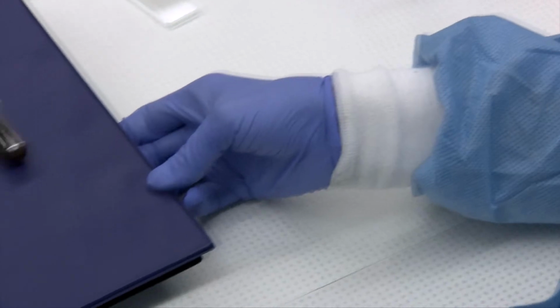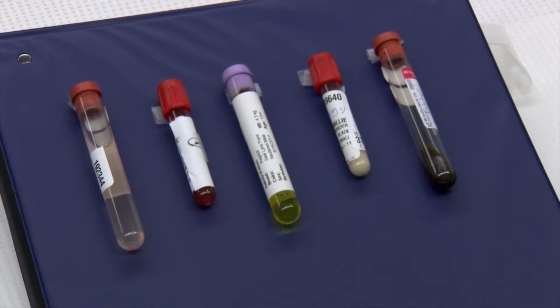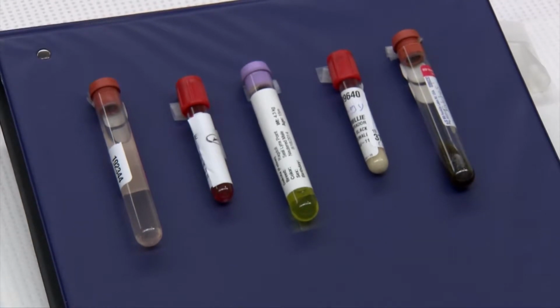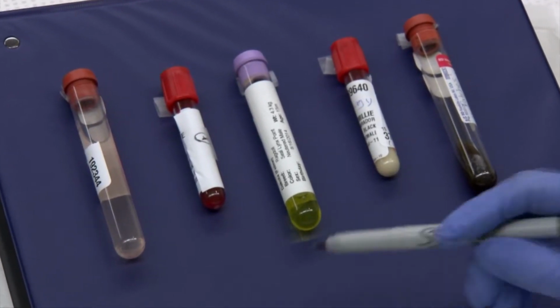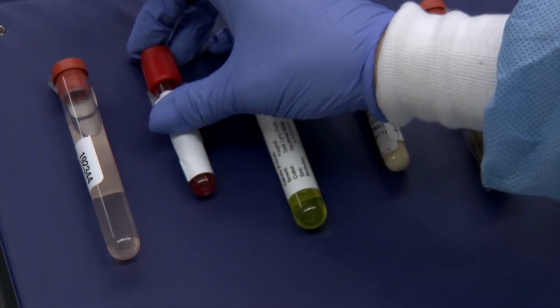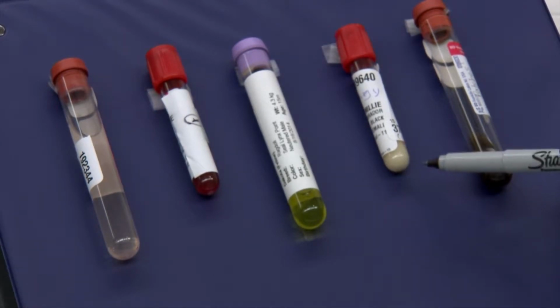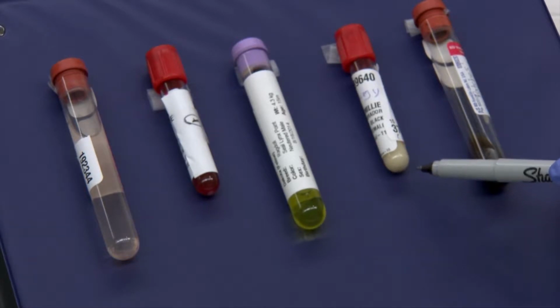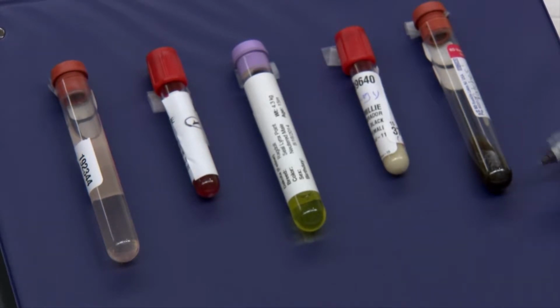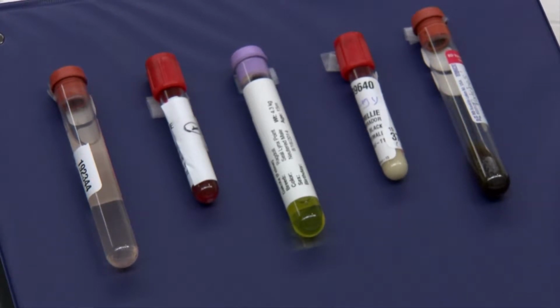Another part of our fluid assessment is that of color and turbidity. Here we have a nice variation as to what we often see. It's kind of pretty open as to how you describe it, but this would be slightly red, slightly cloudy. This moderately red, moderately cloudy. This would be bright yellow and clear. This one appears to be opaque or turbid and lipemic. We do get that. And this one appears to be green and cloudy, and that is potentially a bile sample. But they run the gamut.